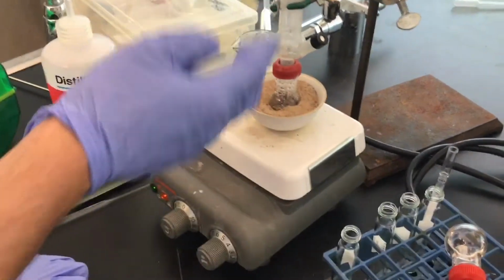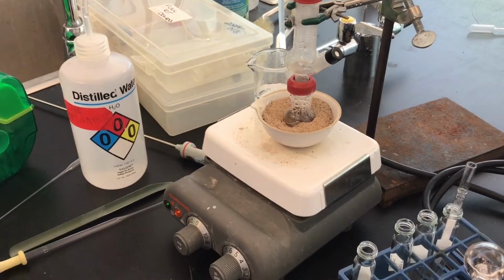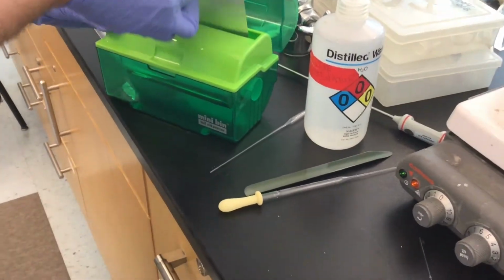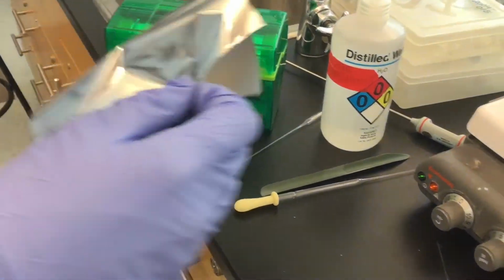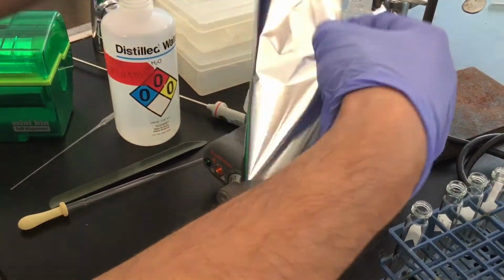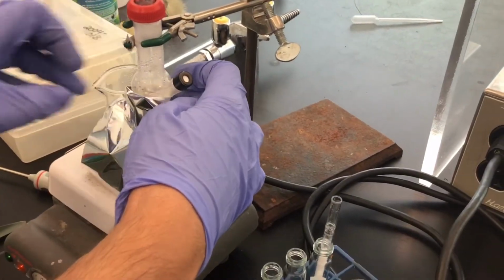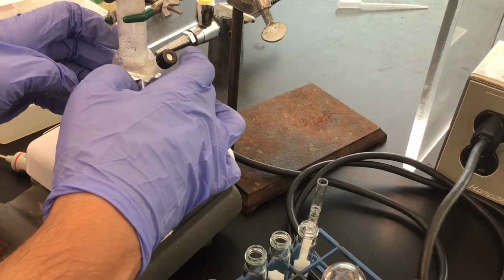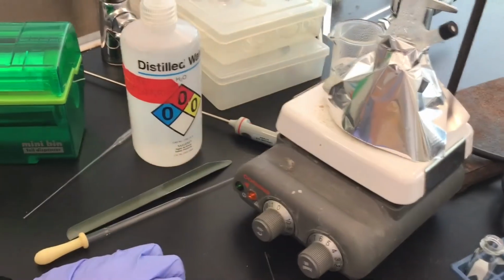All right, so this process actually is taking a good amount of time. So we have decided to use aluminum foil to tent it. So this is just a fancy little holder of a roll of aluminum foil. I don't have to take off too much. Should be enough. And what I'm going to do is just very loosely tent this area. And so what this is going to do is insulate the boiling pot, the distillation pot, so that it'll hopefully distill faster.